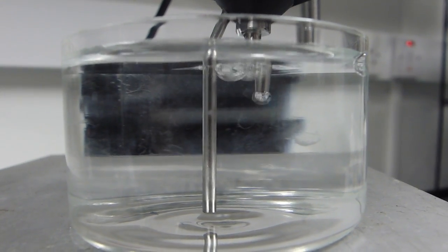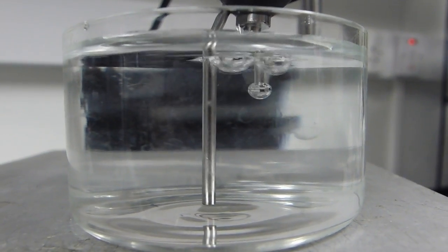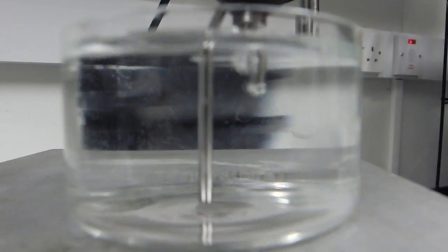As the experiment runs, bubbles are formed with the relevant surface age, and the hardware and software together calculate a value of surface tension for the fluid.